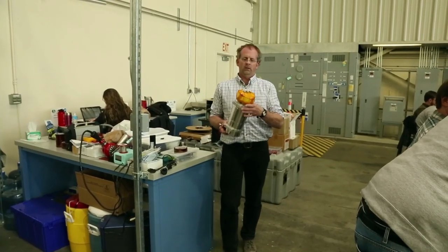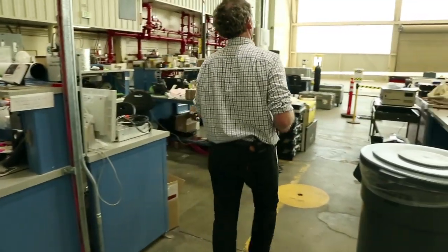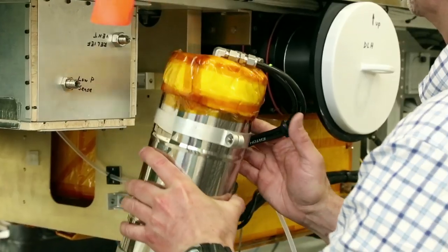The sample also goes through an additional step of water removal, which is a tube that goes through a dry ice section that removes a small amount of remaining water vapor not removed at the front end. This instrument also measures water vapor, but not really well enough for the stratosphere. So rather than need to make a correction for water vapor, we just remove it altogether. And that helps with the precision of some of the other measurements as well.